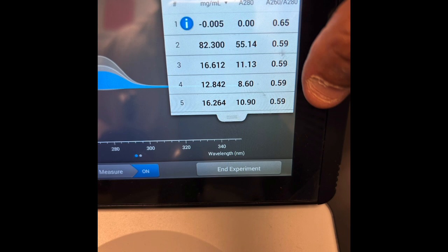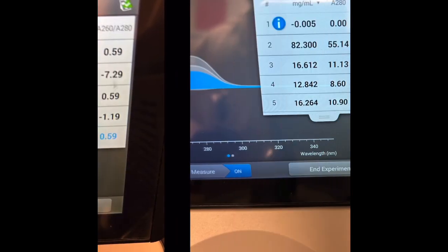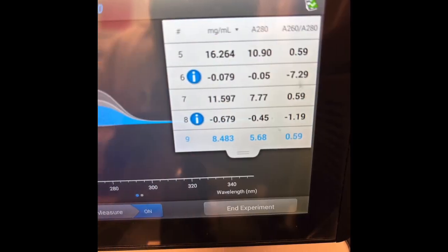Then comes my Opentrons runs, where I made the Opentrons pipette 1 microliter into 9 microliters of DI water that I added, and it was very inconsistent. The OD280 was either 16 milligrams per milliliter, or it was around 13. It did 16 twice, and it did 12 about twice.